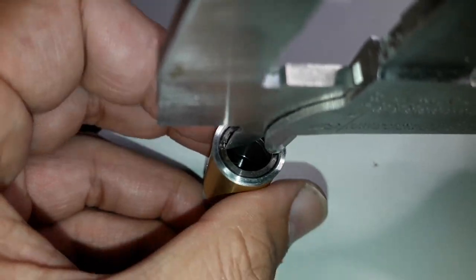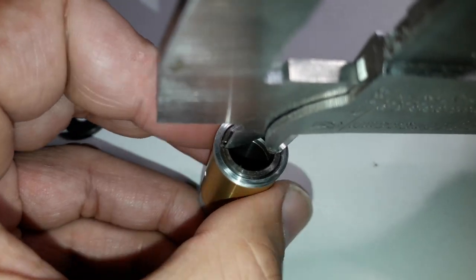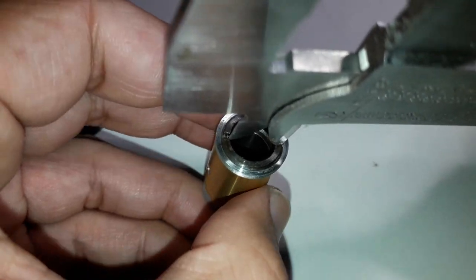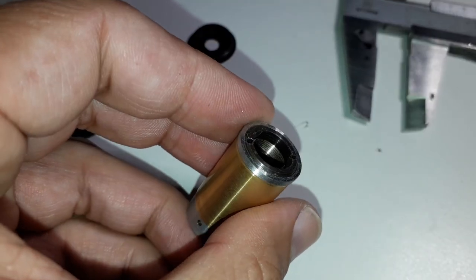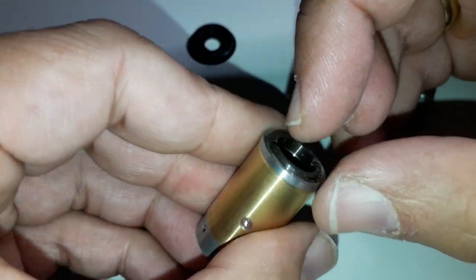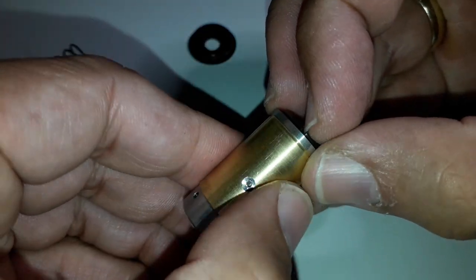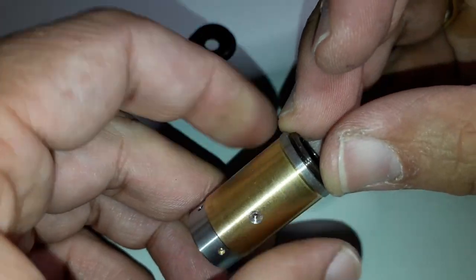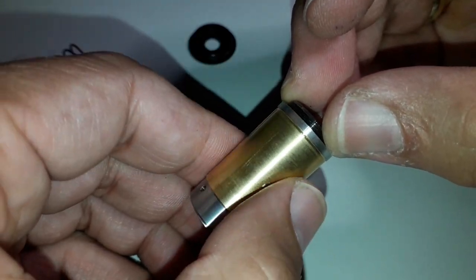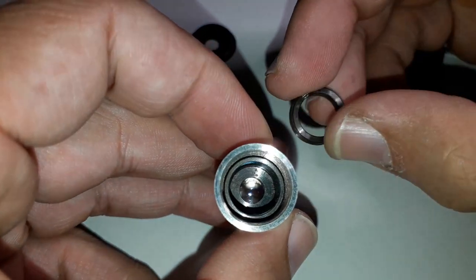So that's basically what I'm doing right now — just turning the barrel, and then continuing with the fingernails. This was actually quite easy to remove, luckily. There was no corrosion there that made it stick. So this inside ring, I've removed that now.